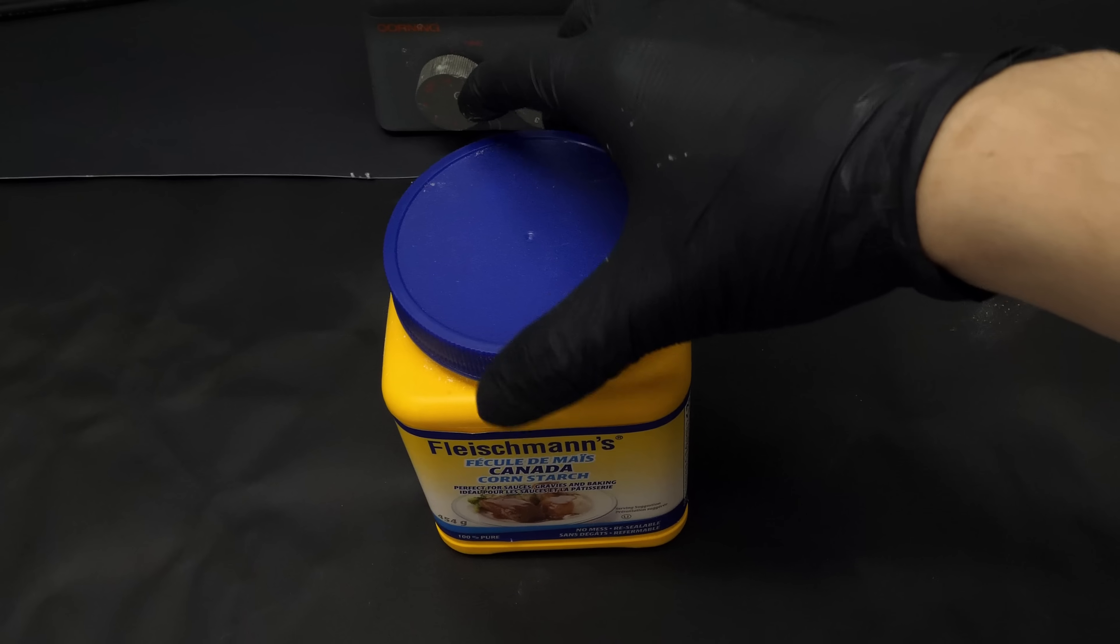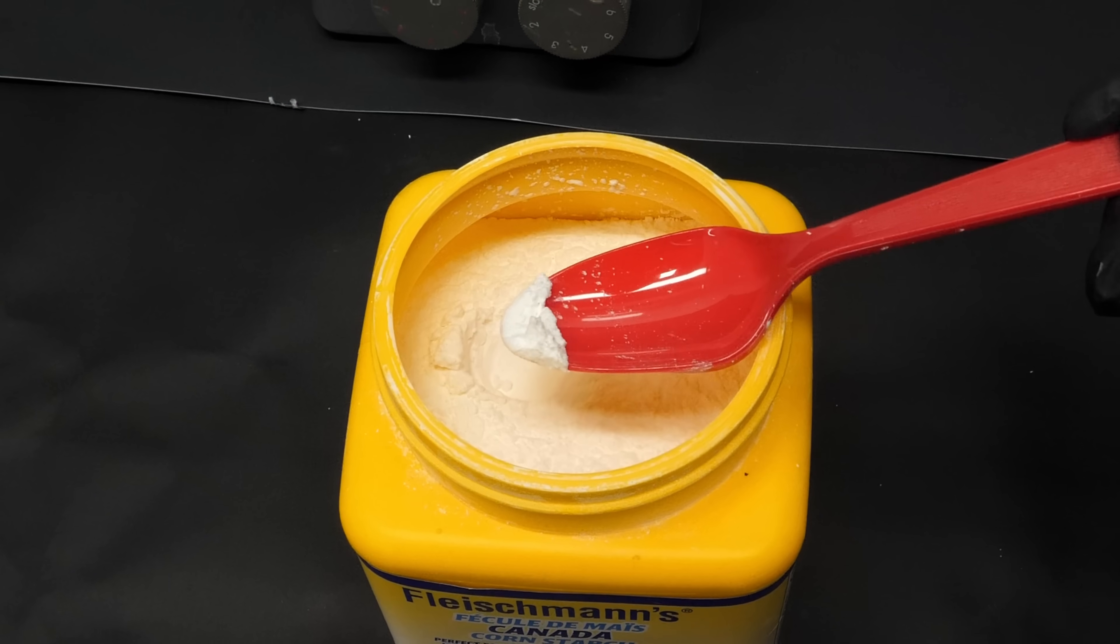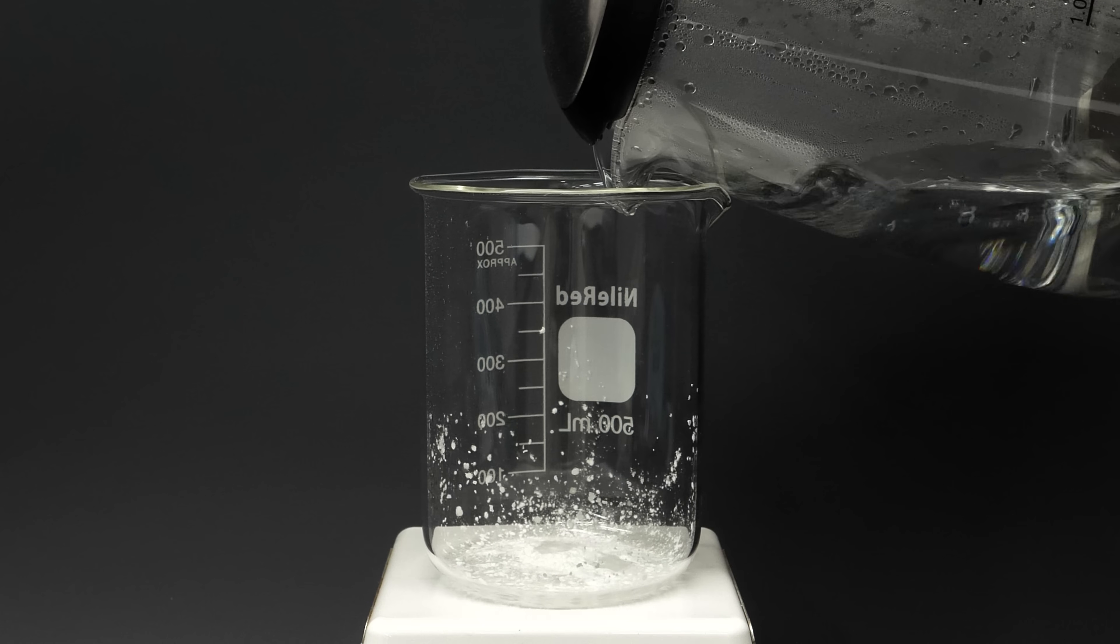I've decided to do a chemical reaction that, in my opinion, kind of looks like magic. The first thing I need is a bit of cornstarch, and I'll mix this with some boiling water.